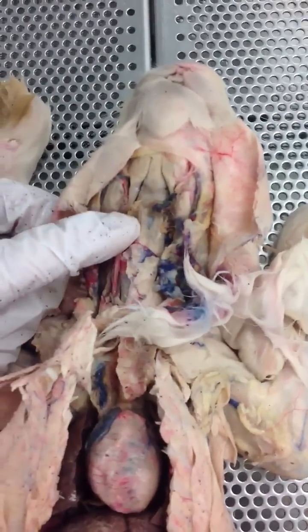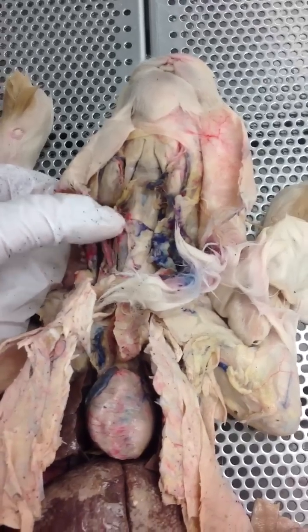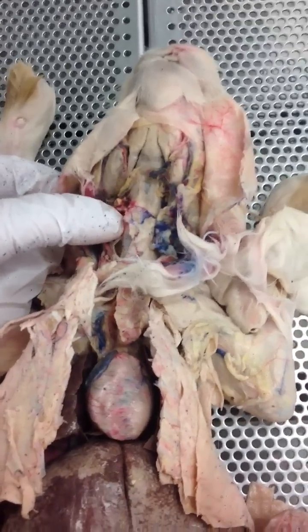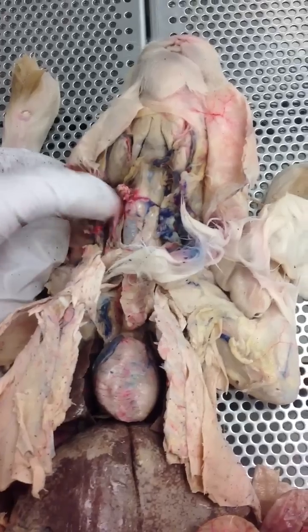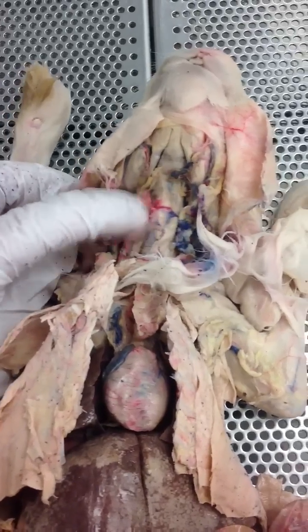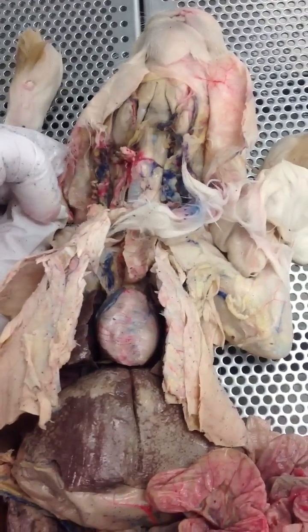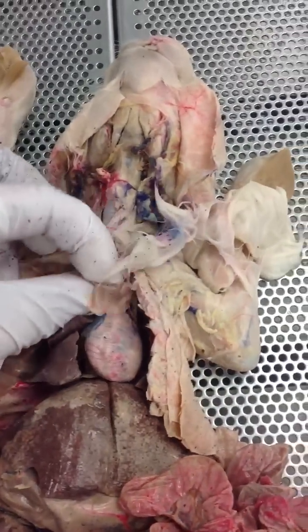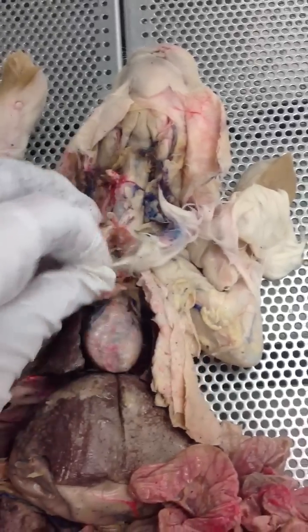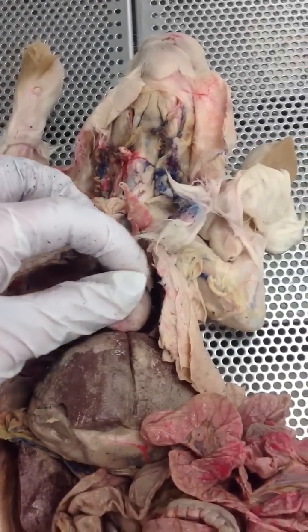Moving into the neck, you're going to have the esophagus in the back, whereas the bronchial tube and the trachea will be in the front. So the two tubes there — esophagus is in the back, and the trachea is going to be in the front. The flap of skin over top of the heart right there is going to be your thymus gland.